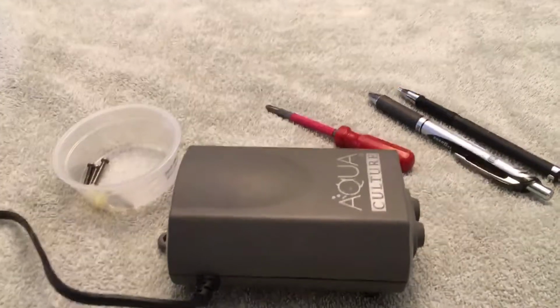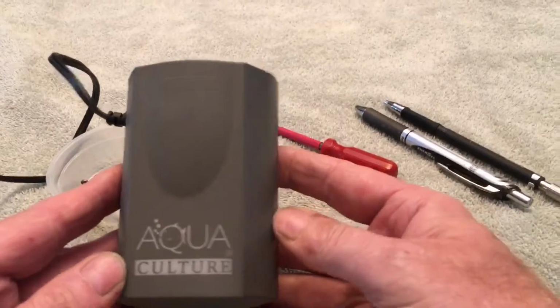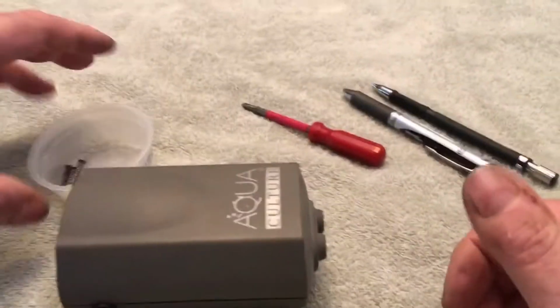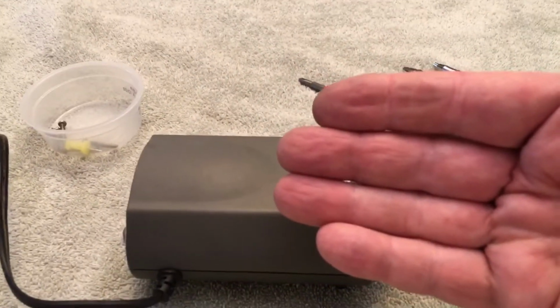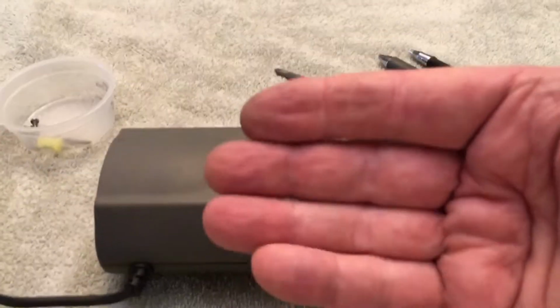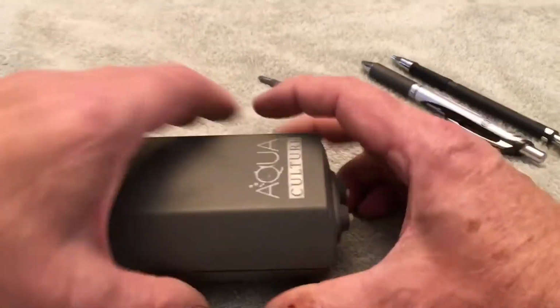Hi, this is a video about turning an aquarium pump, this is Aqua Culture, which is available at Walmart, into a vacuum pump. And to do that, you have to reverse the valve so they flip open when it's sucking air and close when it's pushing air, so that instead of being a pump, it's a vacuum.